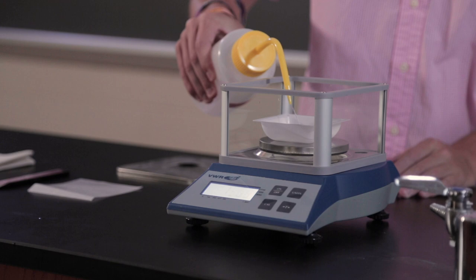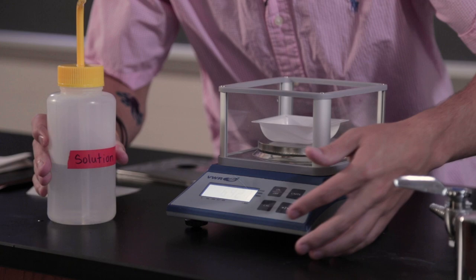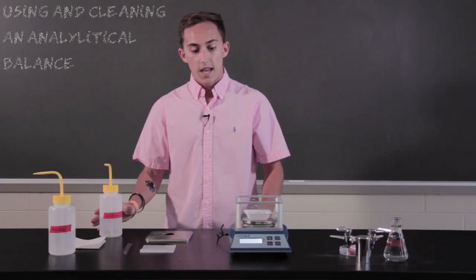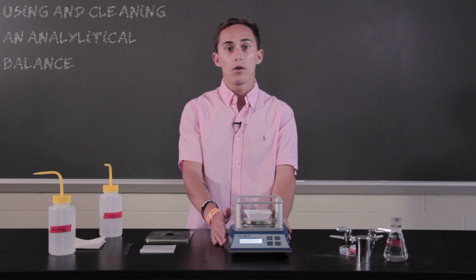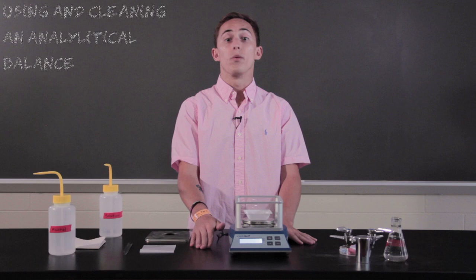And you can add in more, keep going, and now you have 6.427 grams. So, it can weigh a good amount, but it does have a max, and you'll know that max when this just does not show anything. It just will be unreadable.